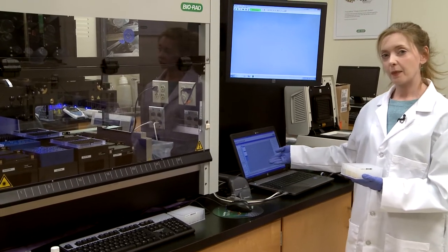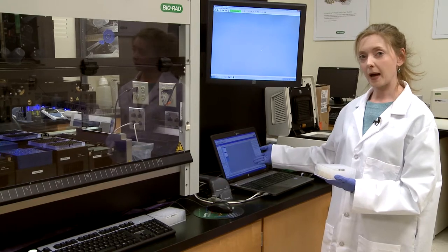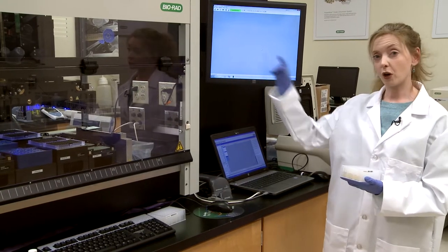I've used the CFX manager to load in the locations of my samples onto the plate map. Now we have to tell the robot what to do.